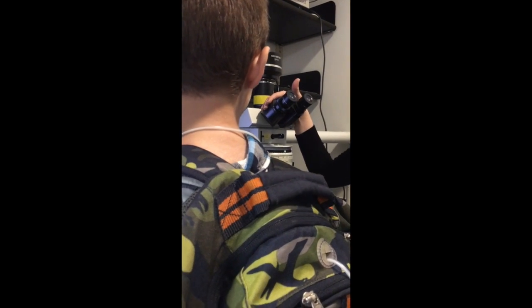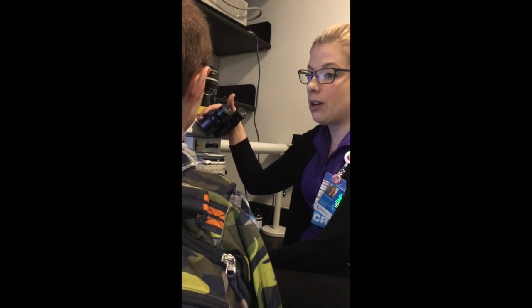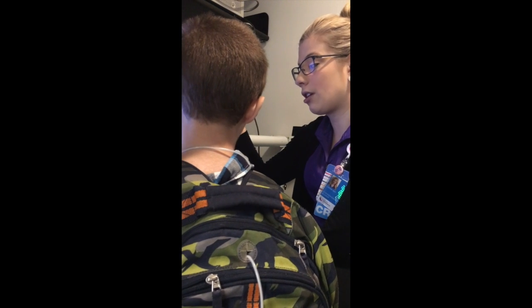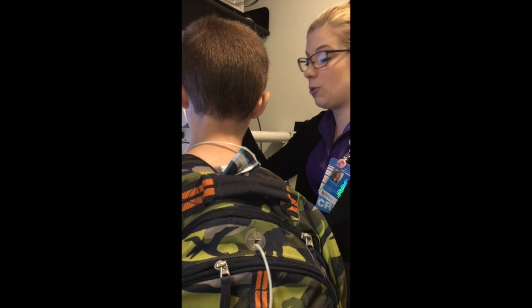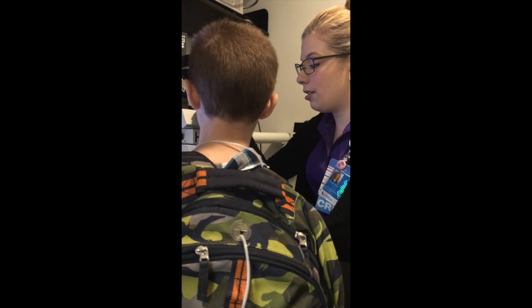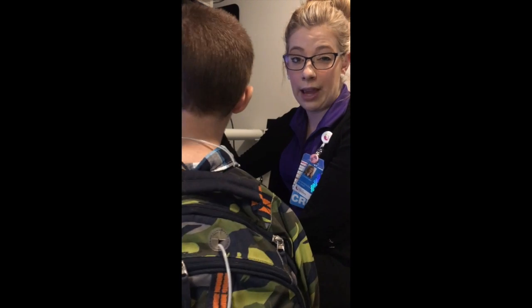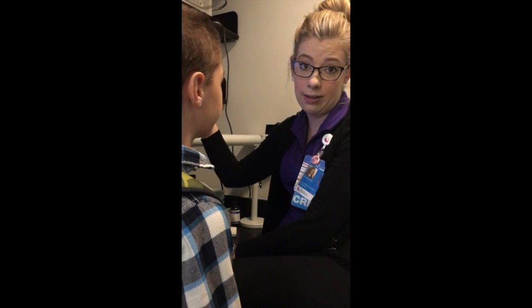And then it varies off of scopes. A pathologist down in the actual clinical pathology may have a bit of a bigger or smaller scope than I do, so we'll be off by 1 or 2. And then Dr. Collins, who is our research pathologist, normally looks over eosinophil counts from slides that get sent from other places.